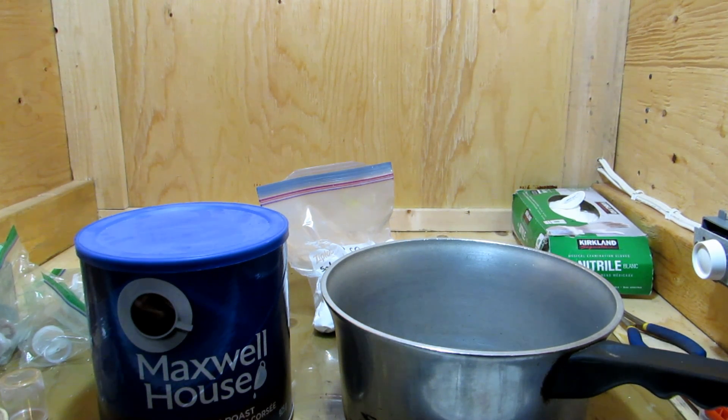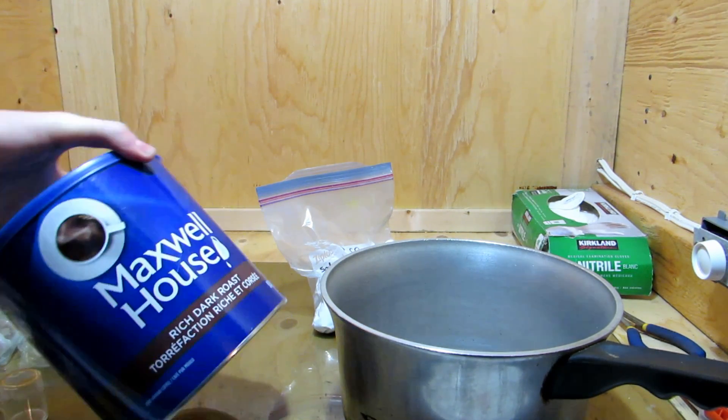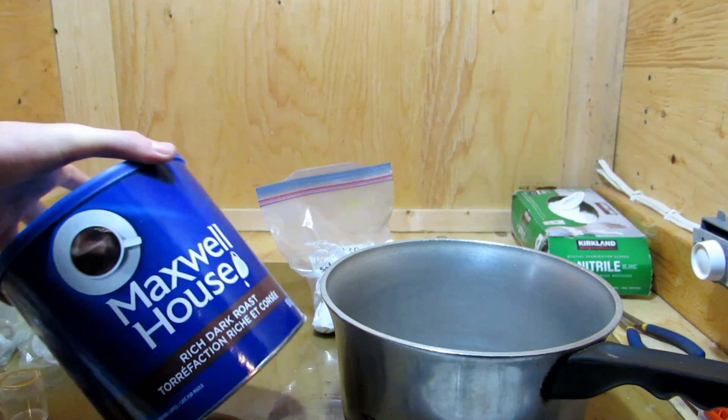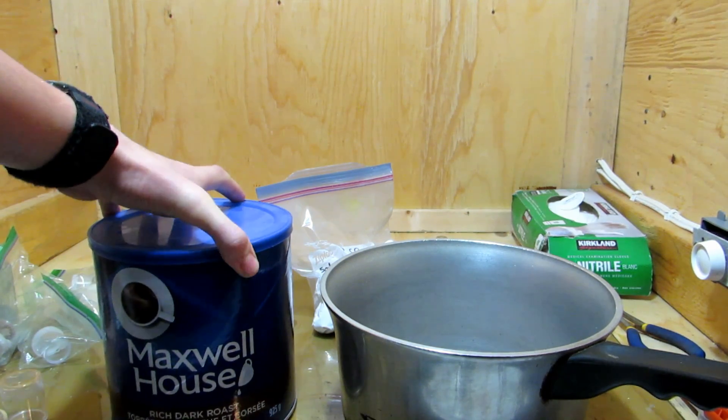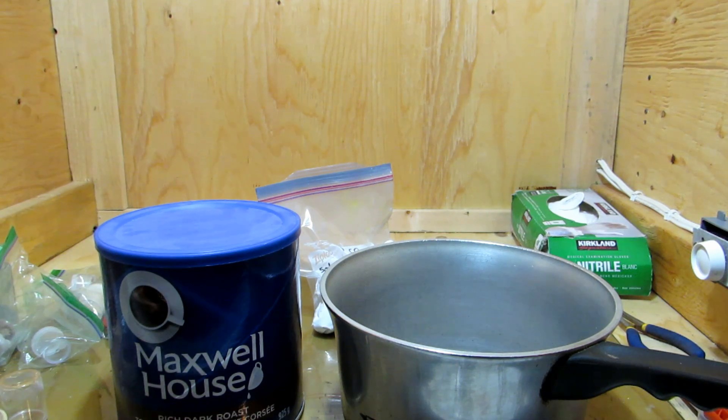Hey guys and welcome back to another video. Today we're actually going to be trying to extract some caffeine from coffee. I bought the cheapest coffee I could, just under one kilogram, and we're going to see how much caffeine is in this entire container.